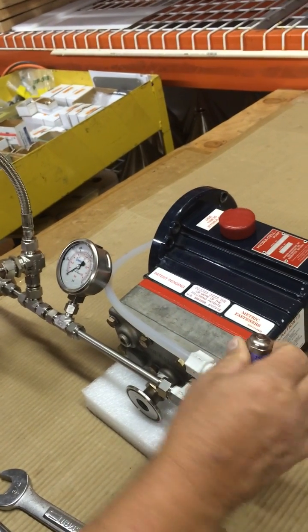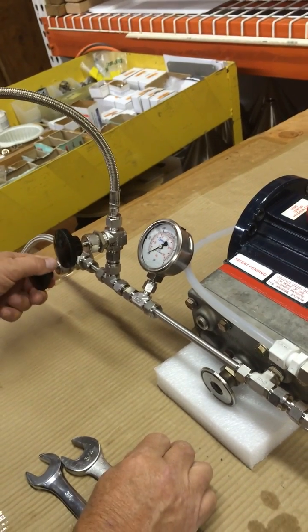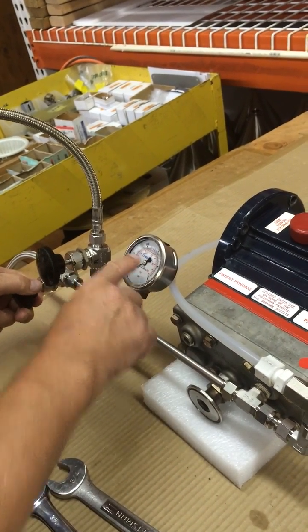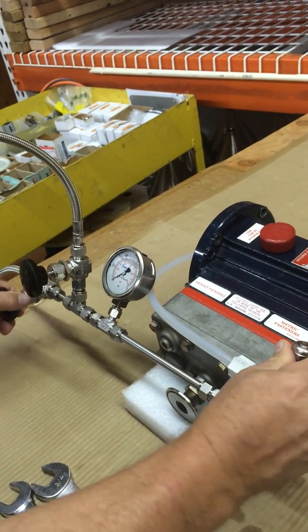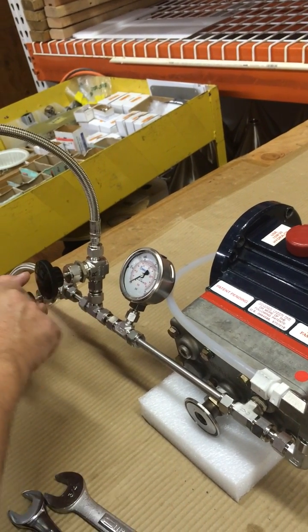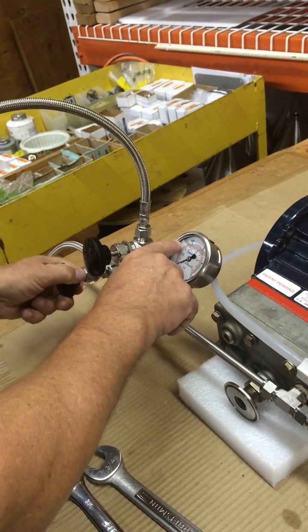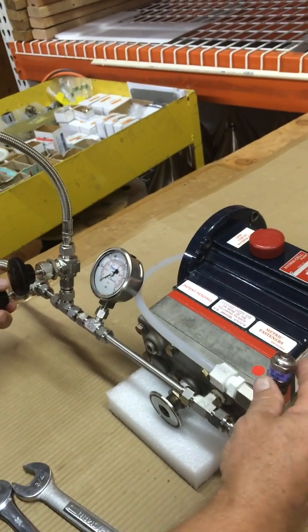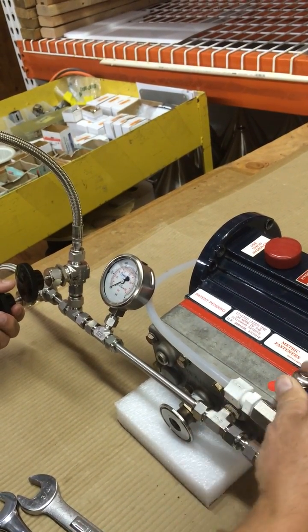Back it off a little, turn this up a few turns, bring the pressure back up over 300. And as you turn this down, each time you turn this back up, bring the pressure up — it should be higher, maybe 400. Back it off a little bit, you can turn this down.